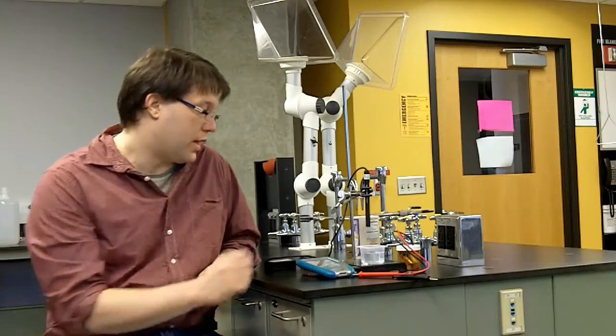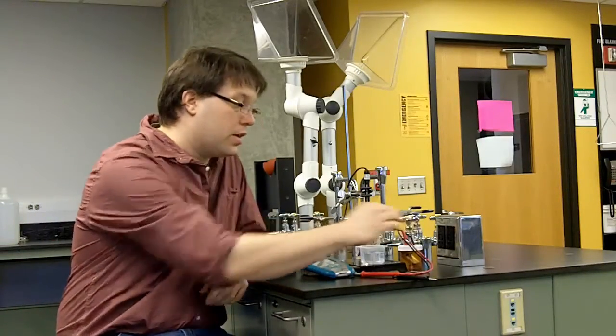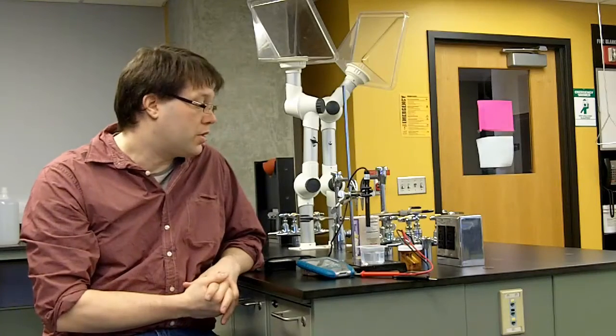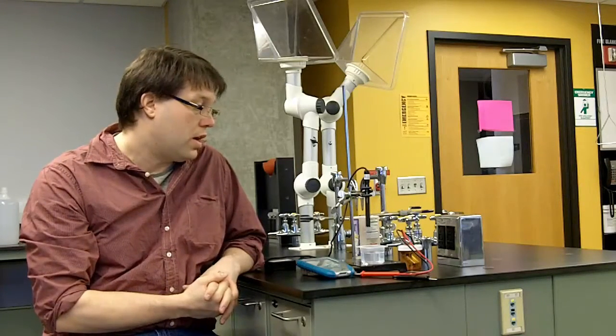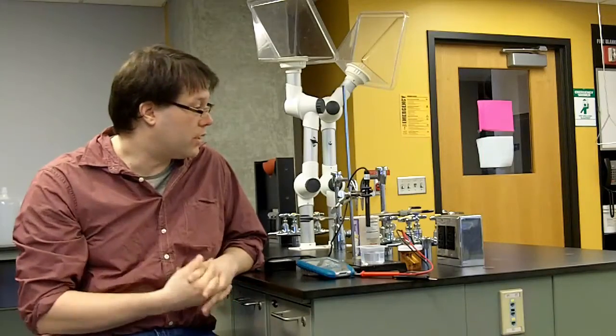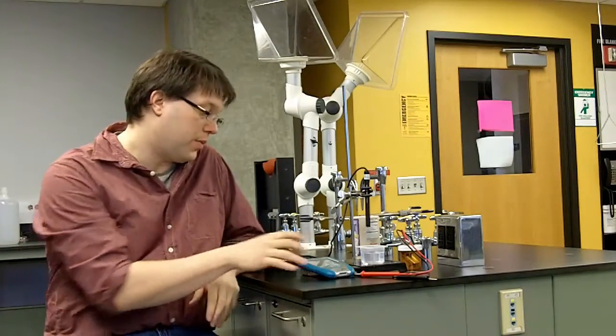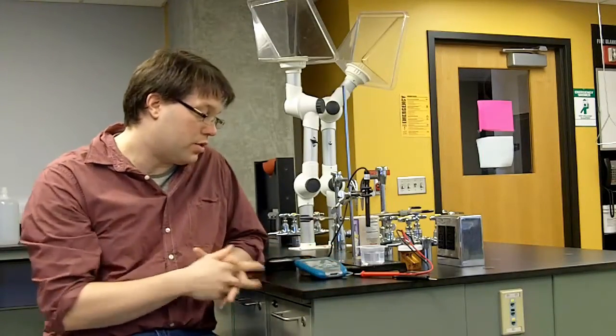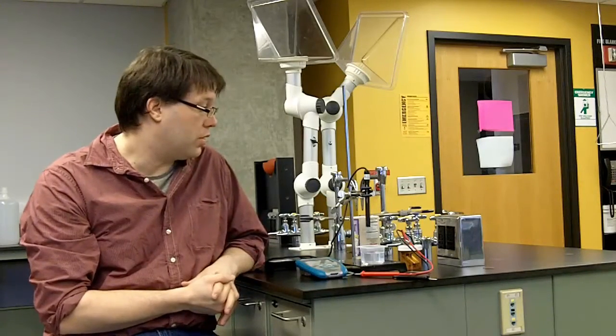Now to measure this we have two different setups. We have over here the conductivity detector that we showed you how to make in another video. This just simply has a LED light bulb that lights up when the solution is conductive. And then we also have a digital meter here from the Vernier company to give us an actual number value.